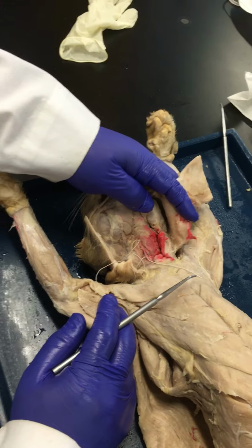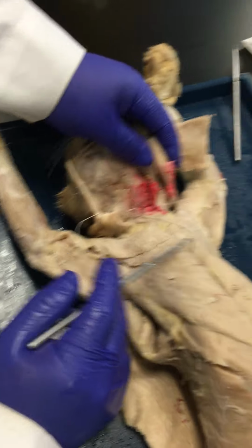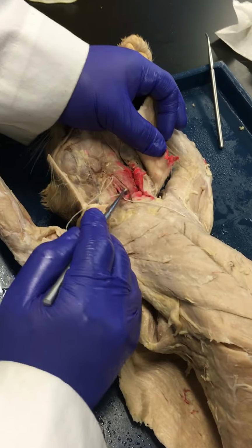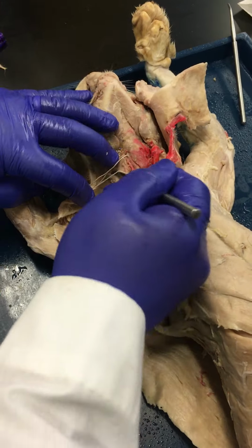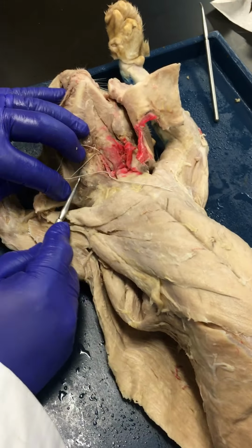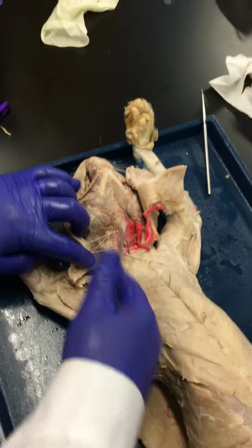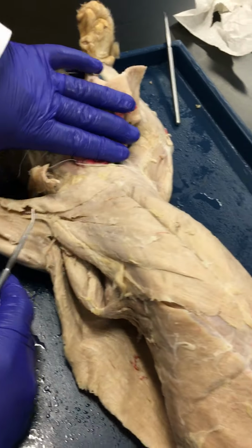Right? So if you're contracting the muscle on the left side, your head is going to turn to the right side. Can you go over where the cleidomastoid and the sternomastoid are on the cat? The cleidomastoid is actually hard to see because it's not separated very well here. But along this area, you would have that. You would have the cleidomastoid there running pretty much along the same length and the same direction as the sternomastoid. So those are those guys there.